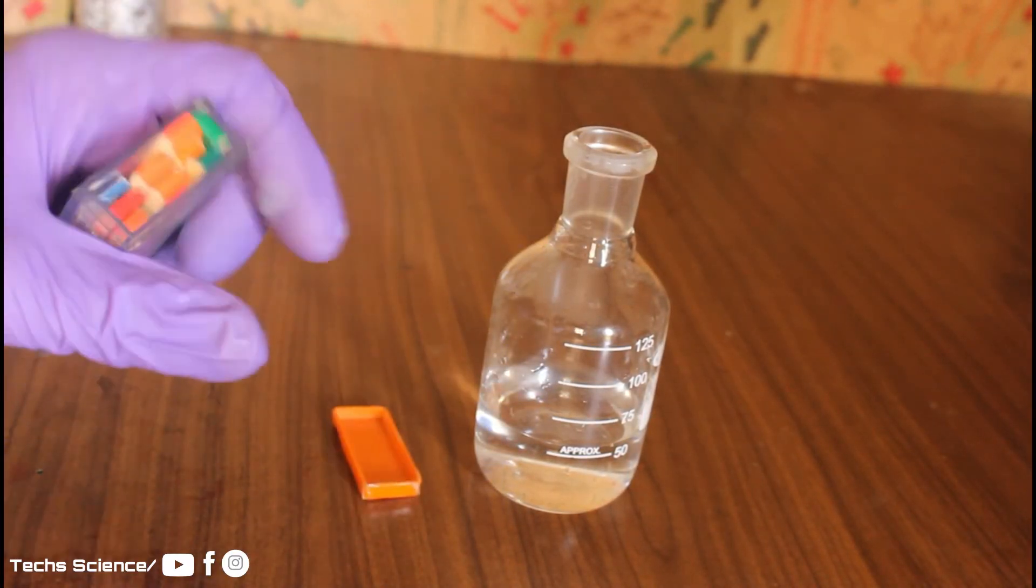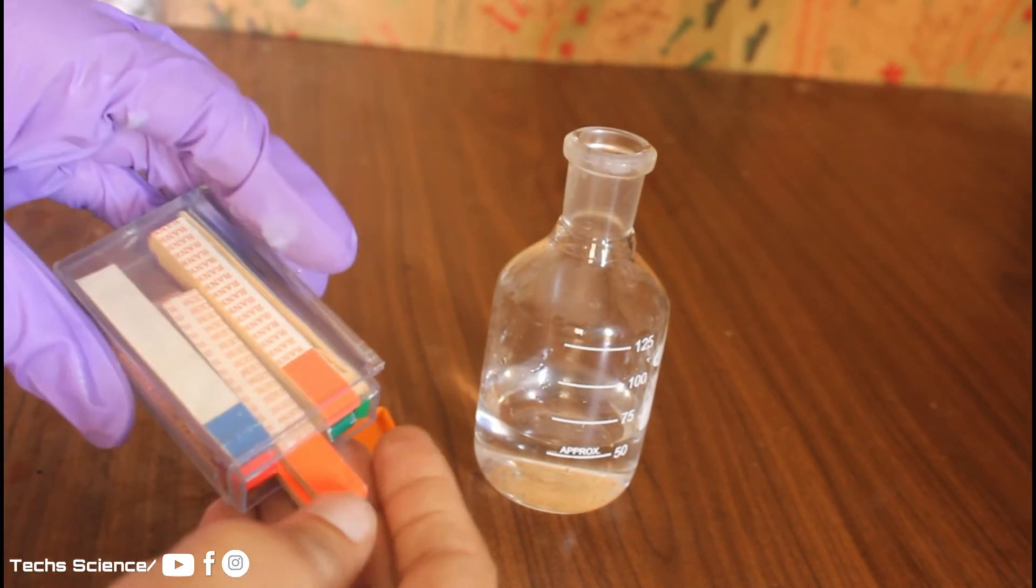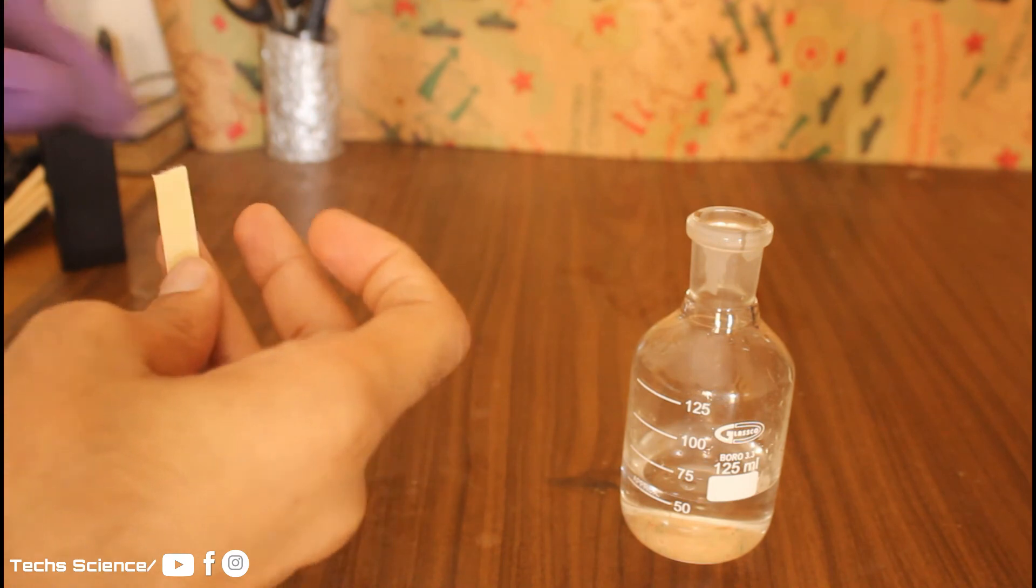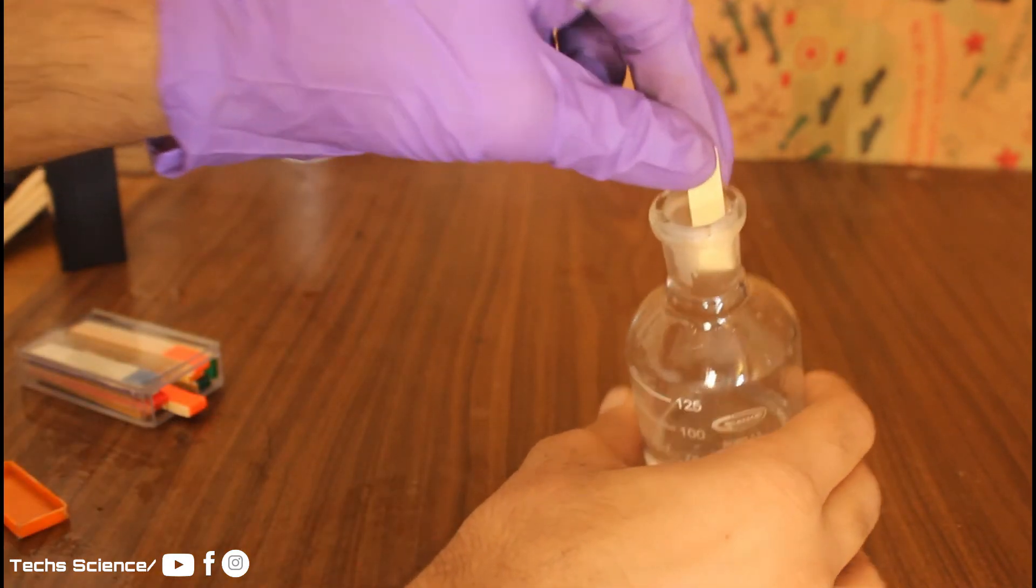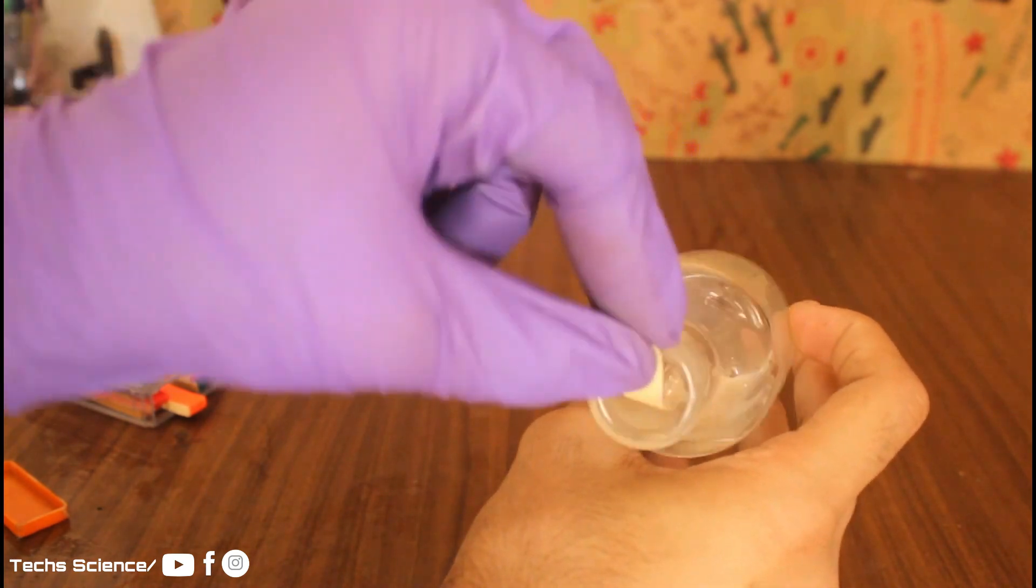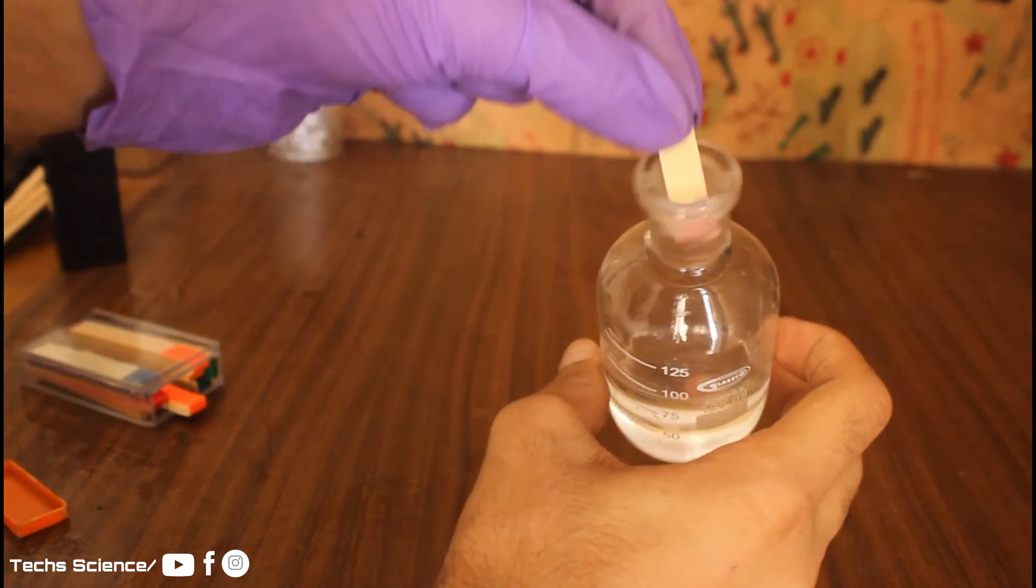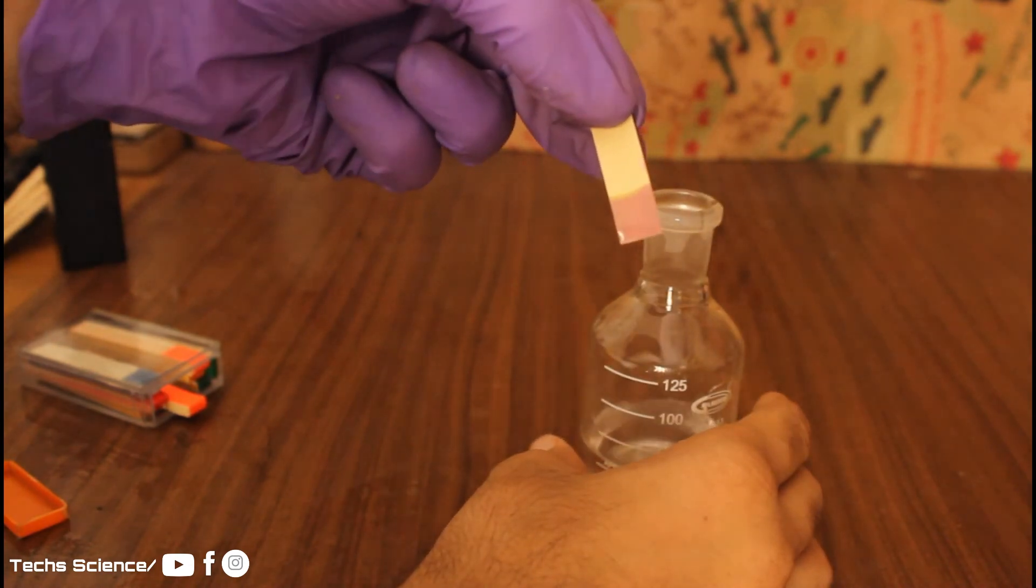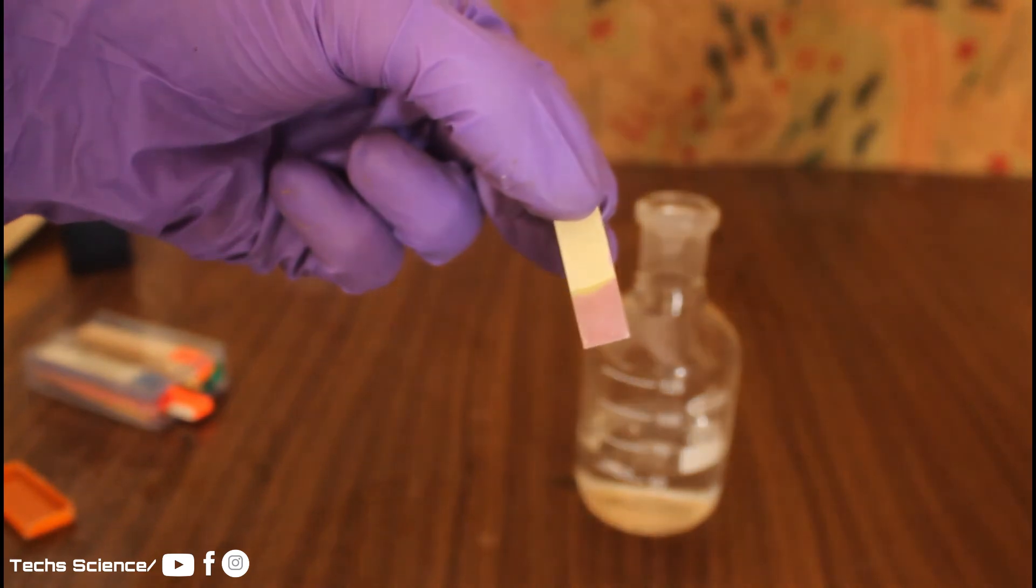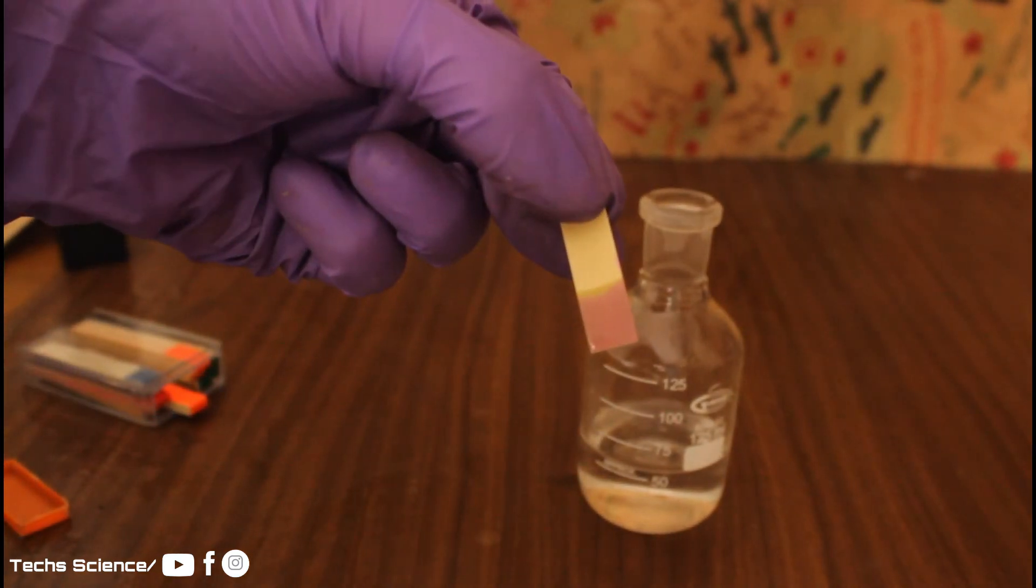Let's see the pH of our product. It's almost two, which is quite acidic.